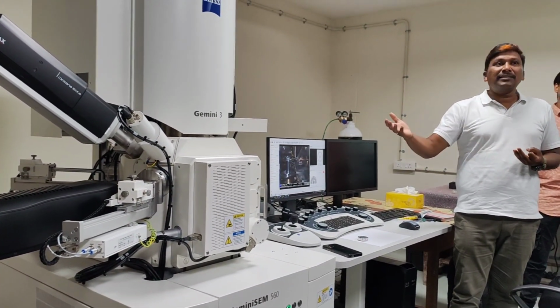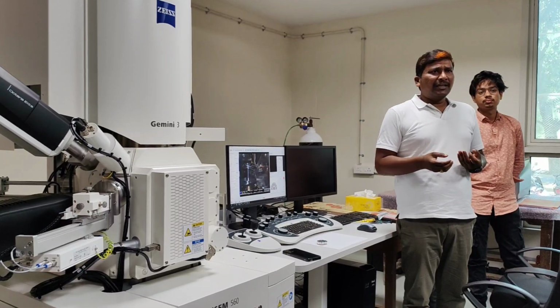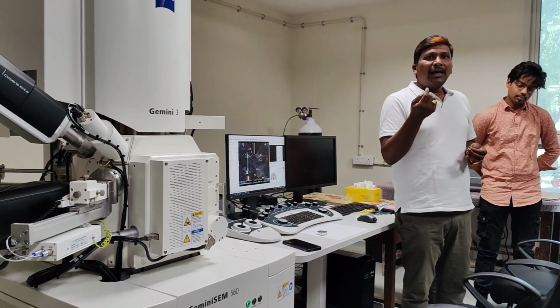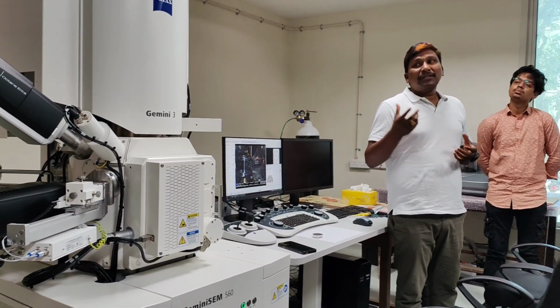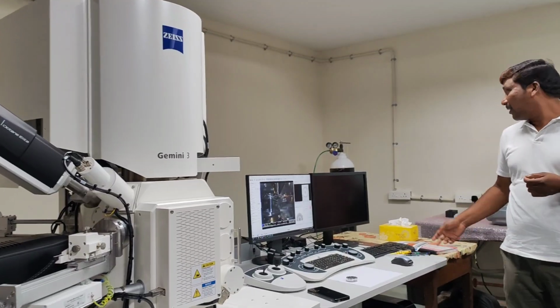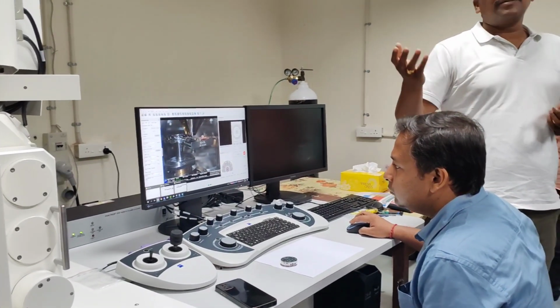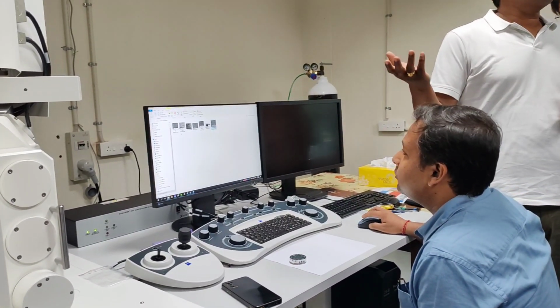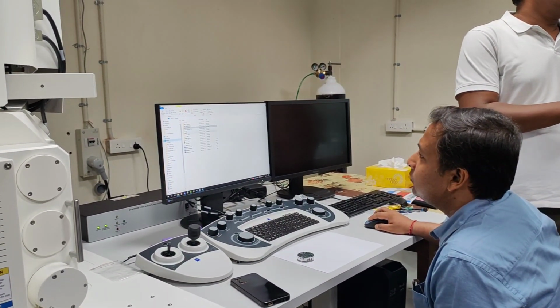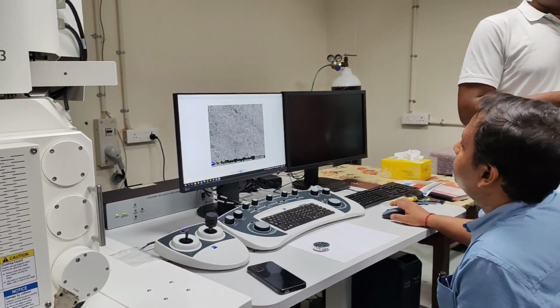The third way is FESEM, particularly the Gemini column, where you can do low kV imaging. That means you are not bombarding with a higher kV, but with hardly 100 volts, 1 kV, or 500 volts, and the system is still capable of capturing high resolution images. A 1 kV image can be captured at very high resolution. The system can resolve sub-nanometer. So I discussed three ways of handling non-conducting samples: gold coating, the variable pressure technique, and low kV performance.